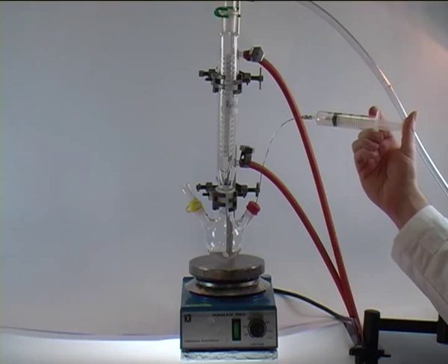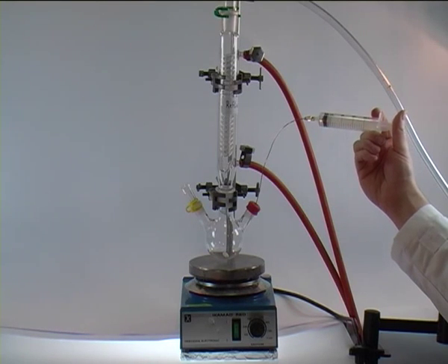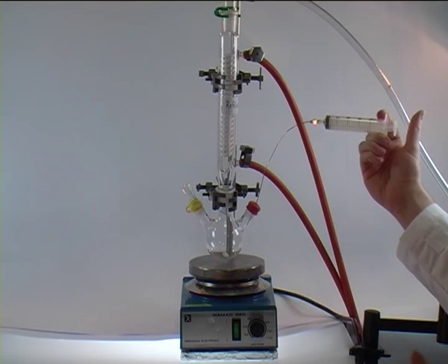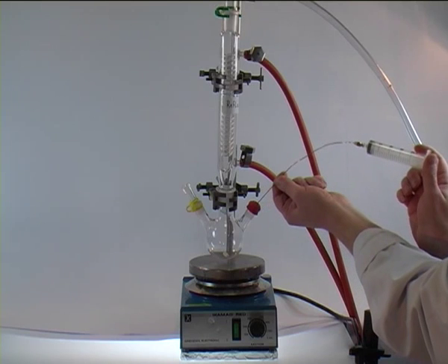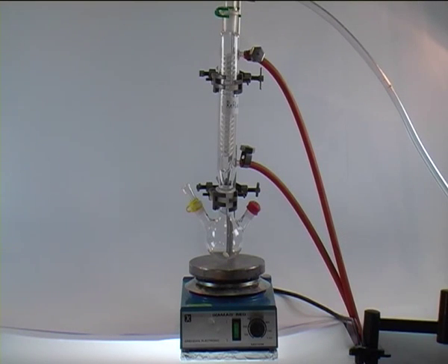This process takes some time, because we don't want to transfer it too fast, but once it has finished, we again hold the needle at the top and pull it out of the septum and take it away.